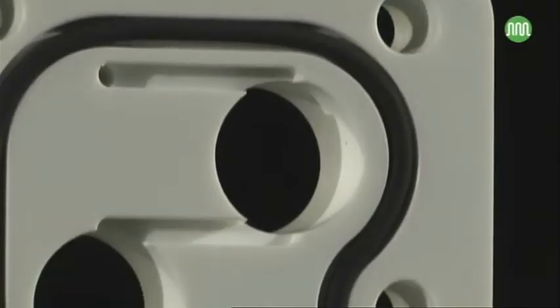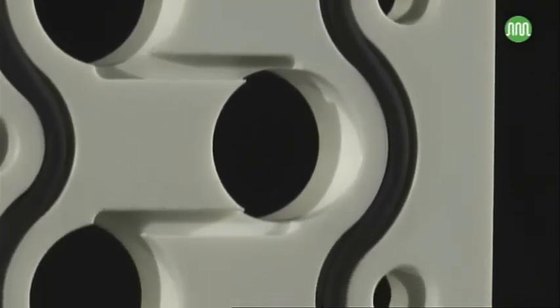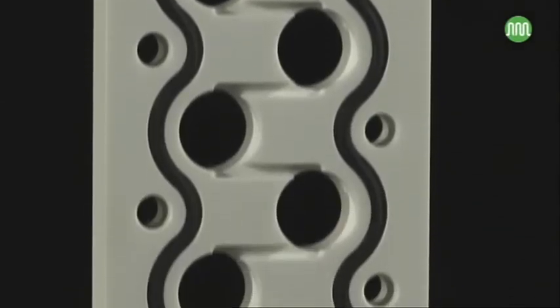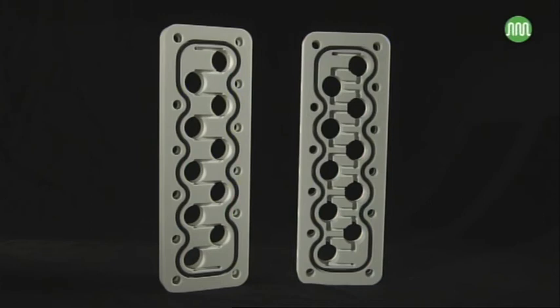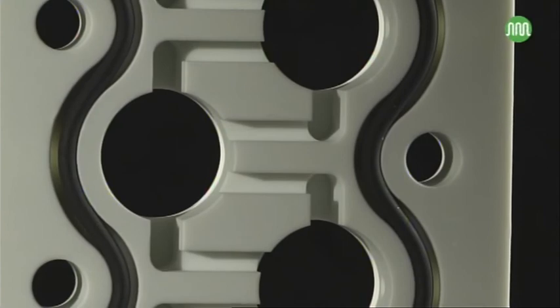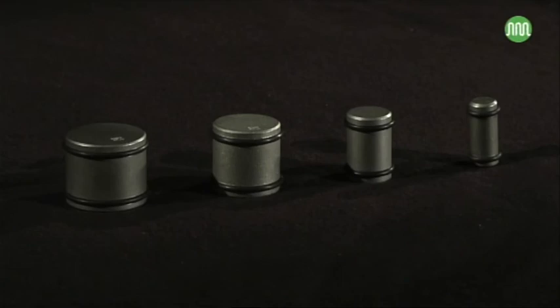The full complement of ten stages can be used in a single train, or split into a series of smaller groups to run multiple unit operations back-to-back. For this, chemical addition points can be added to different stages as required. Reactor blocks for co-current and counter-current operation are also available, and different agitator types can be used to vary the mixing conditions and stage capacity.